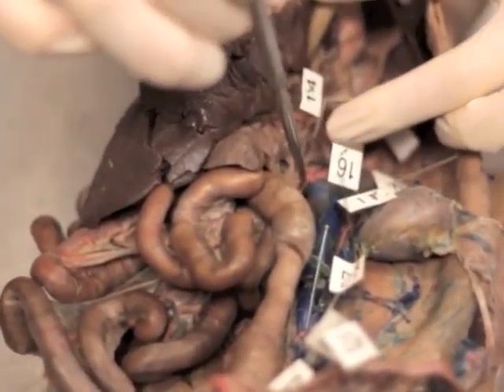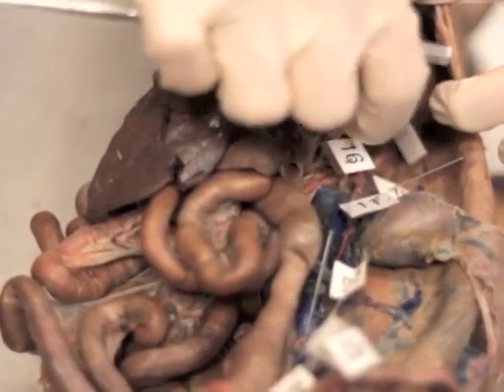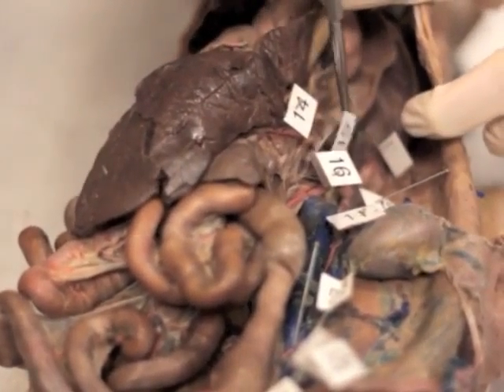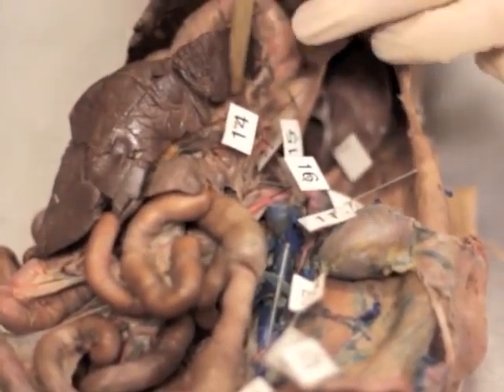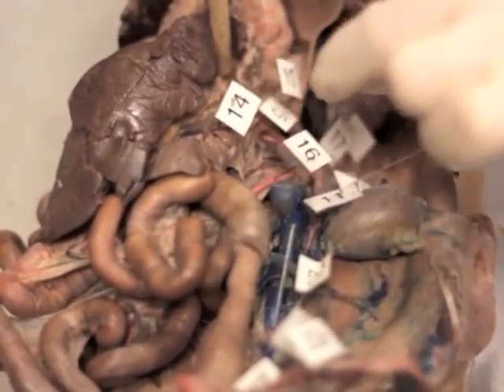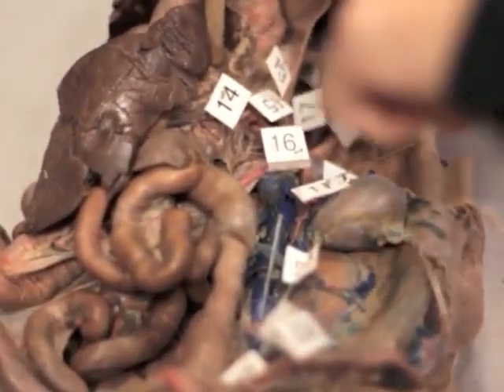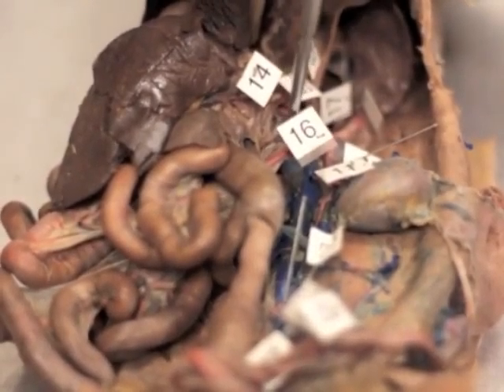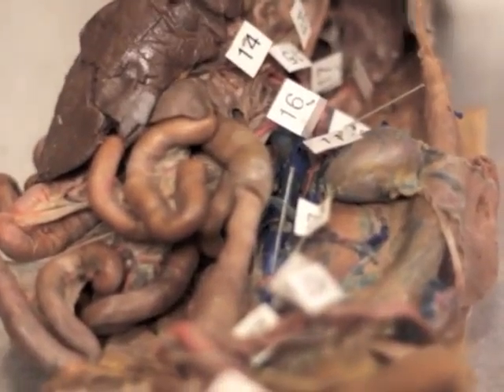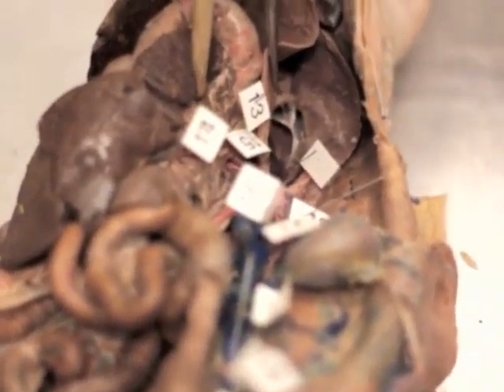And here is 14, our superior mesenteric. Yeah, 14 is the splenic. And then this is the superior mesenteric. Let's see. Right underneath the trunk of the celiac, right? I always think it's just right inferior of the celiac trunk is where the trunk of the superior mesenteric is. Okay. Yeah. And then, let's see. What happened to 17 here? 17 is supposed to be over here.